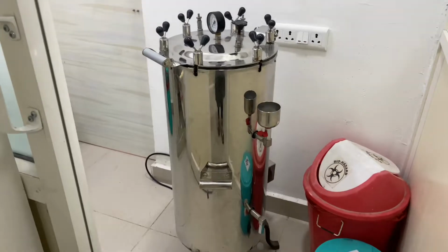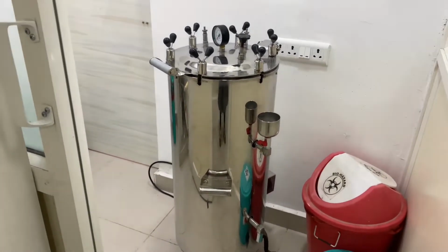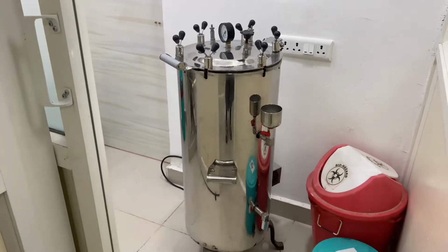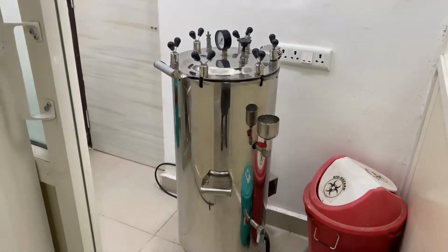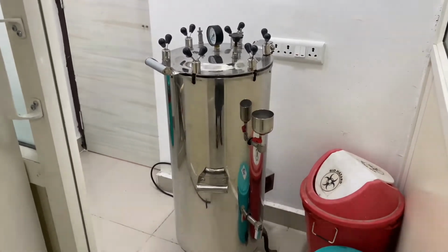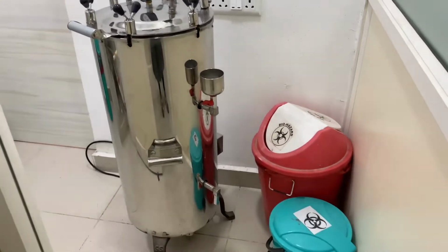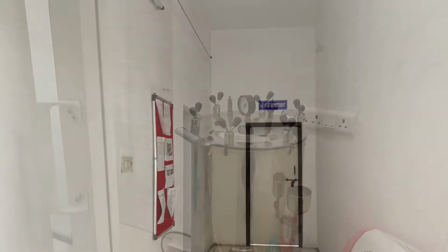Just disposing of the waste material is not good, because it is hazardous and not good for anyone's health. That is called biohazardous material. Before disposing, we autoclave it for sterilization. If any microorganisms or viruses are there, they will die when we do this procedure. So finally we dispose of it. I hope you understand this.